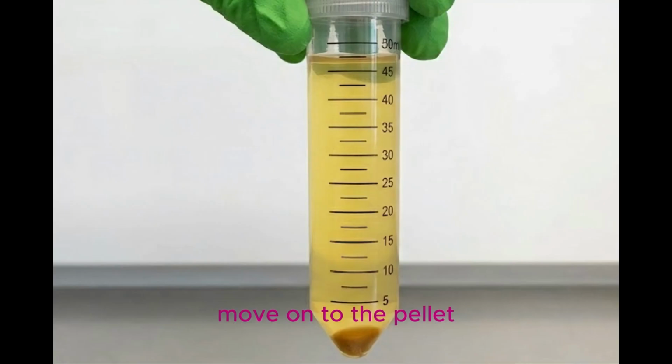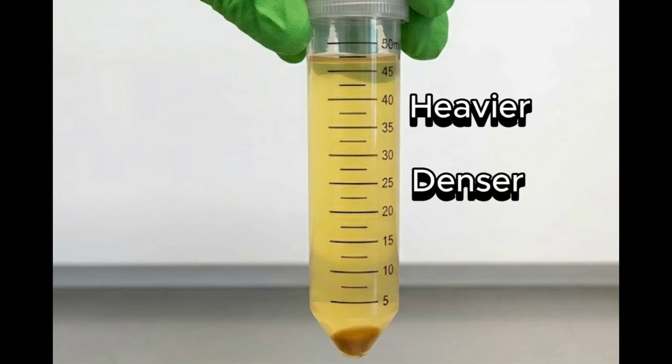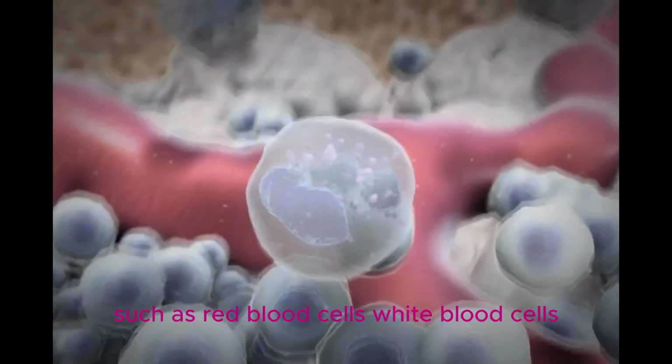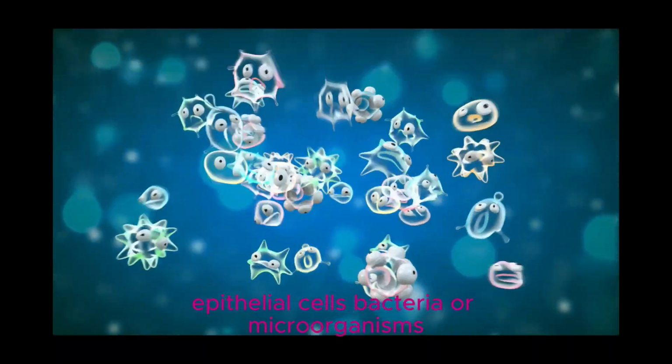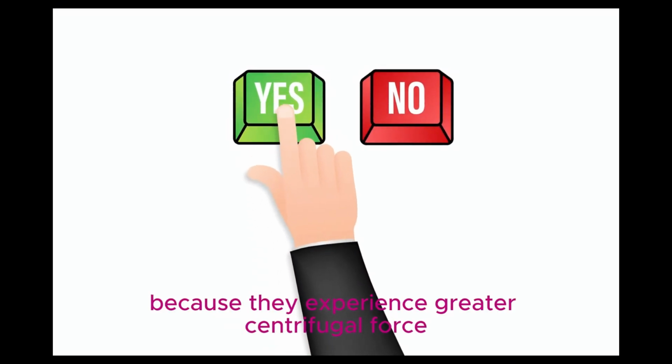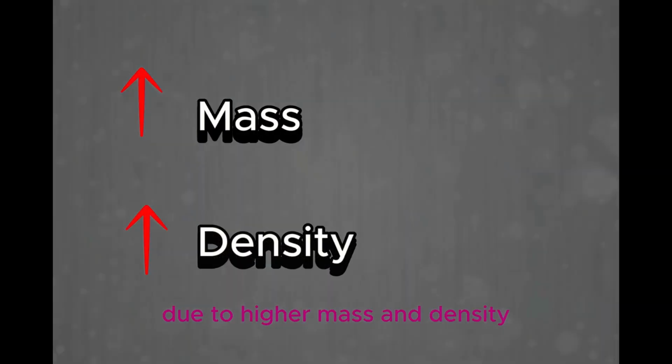These remain in the liquid because they are too small or too light to be pushed down by a centrifugal force. Move on to the pellet, which contains heavier and denser particles, such as red blood cells, white blood cells, epithelial cells, bacteria or microorganisms, crystals, and also casts. These particles settle because they experience greater centrifugal force due to higher mass and density.